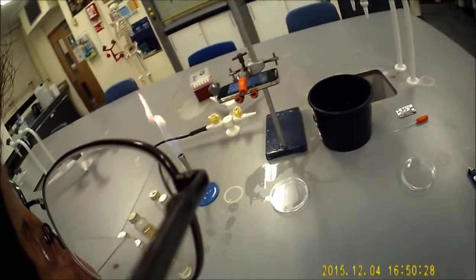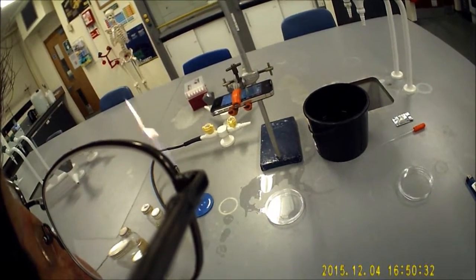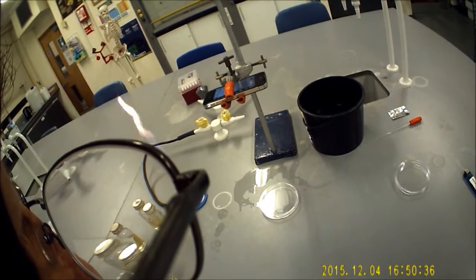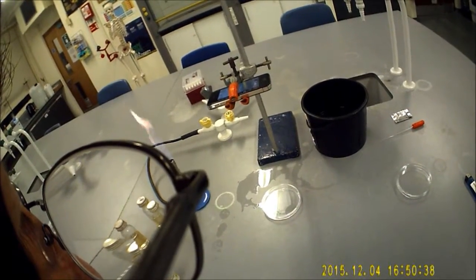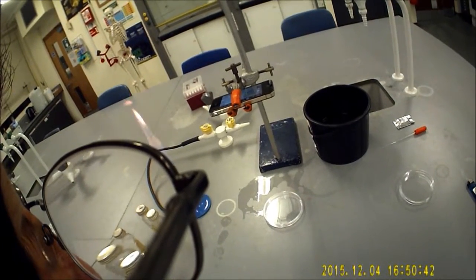Today I'm going to show you two ways of preparing plates in order to carry out a mutual inhibition practical where we're going to set two different species of bacteria against each other and see if there's any inhibitory effect between them.